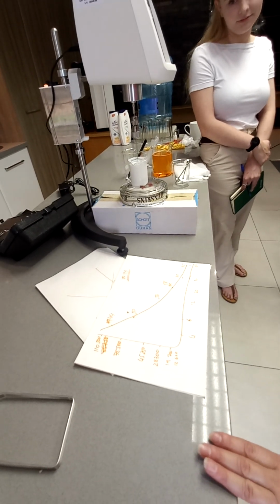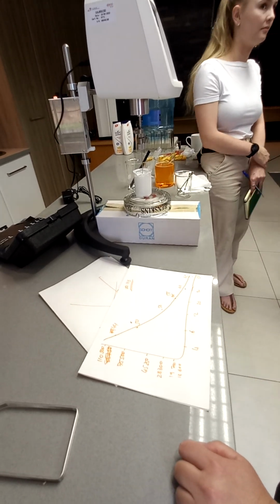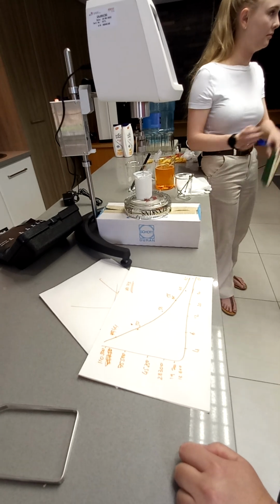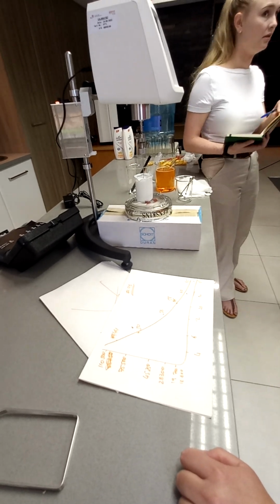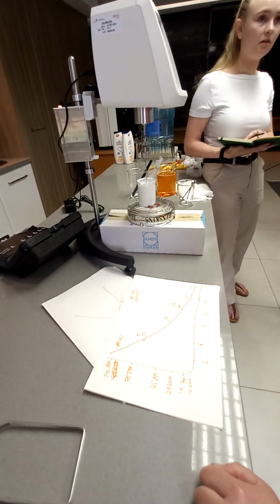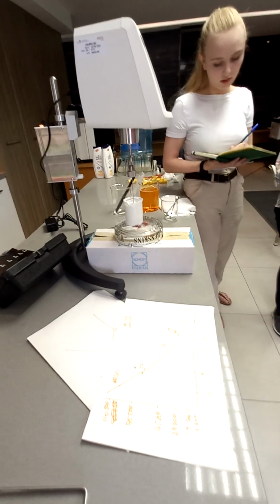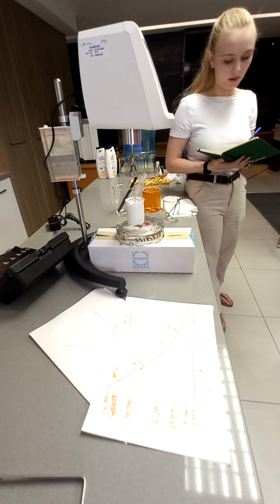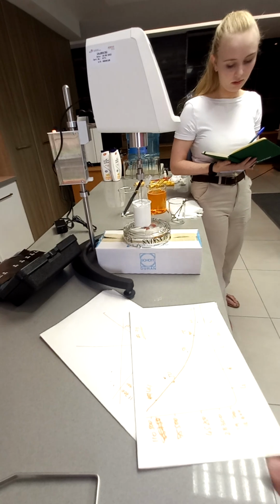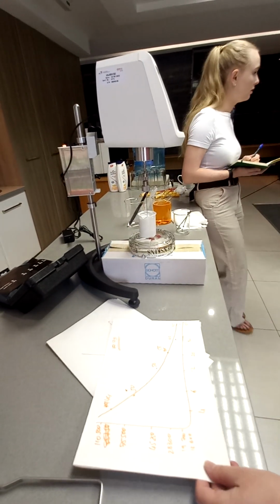Just with Helipath, don't you test at no more than 12 RPM or 20? Not above 12. Yeah, you don't want to go too quick in a non-flowing sample. So any speed 12 or below is good. But you don't want to go too slow either. You aim for the lowest speed possible.